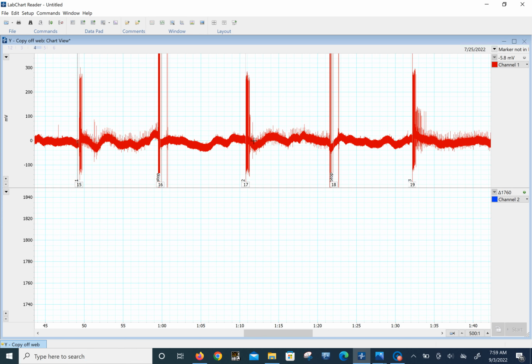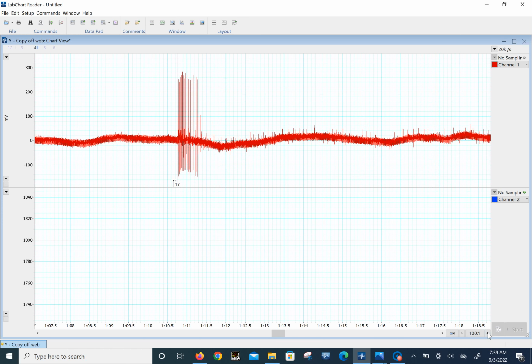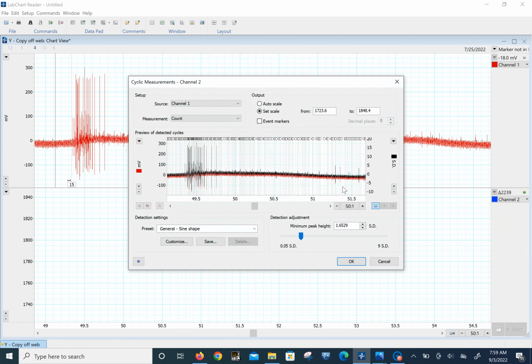So we click here. Let's expand this. And let's go back to that first one. That's the stop. And we see we got kind of these large ones again, and then these other ones. But let's keep the same standard deviation that we just used. And you see 49.5, 49.5. So we have to make sure it's matching.